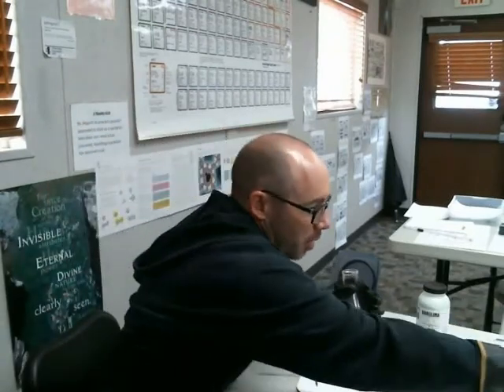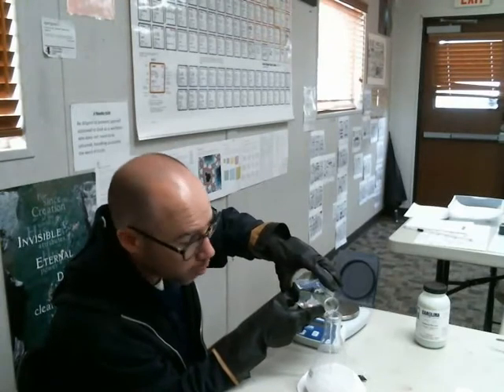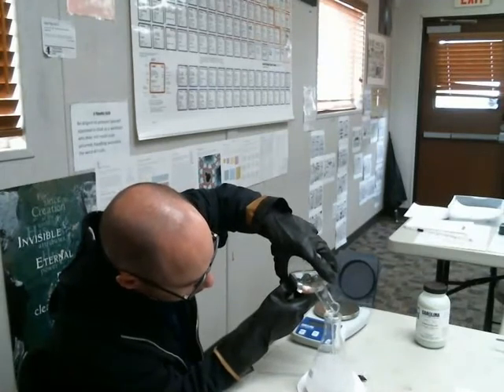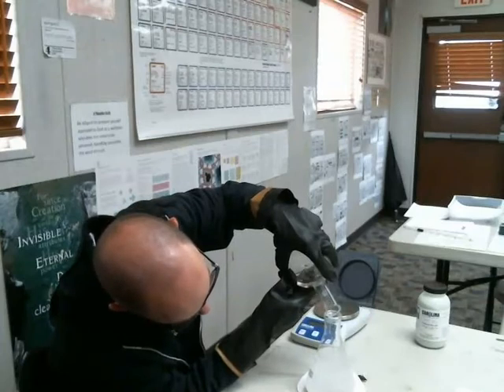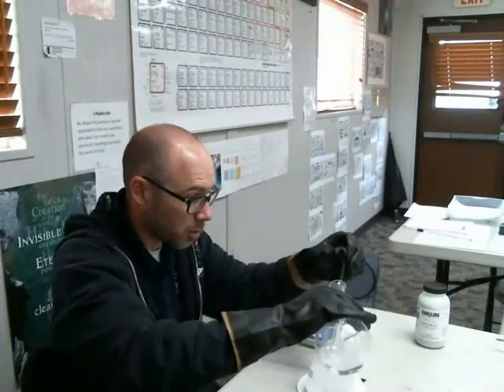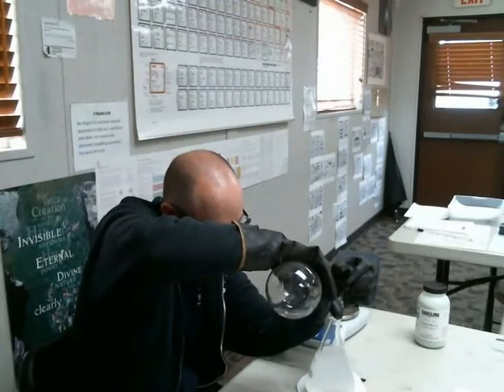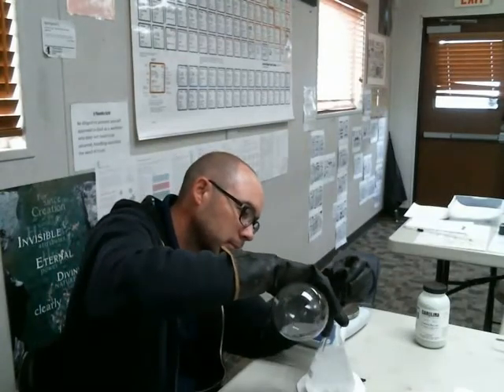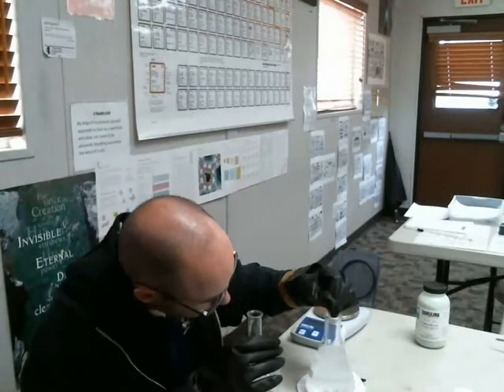All right, that looks pretty good. We're going to top it off by pouring enough water in there to get it close to that line. Again, we really don't exactly measure the water. We just pour enough in there to get us up to that 500 milliliter line. And we call it good. Oh, the anticipation. All right. Close. Maybe we want to use the stirring rod. Pour it down the stirring rod. Really close to it. A little bit more. All right. Pretty good.